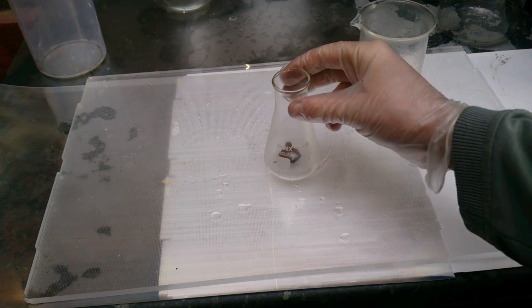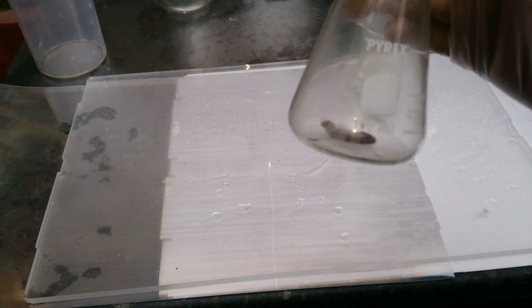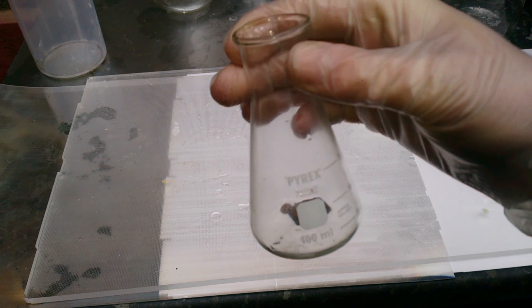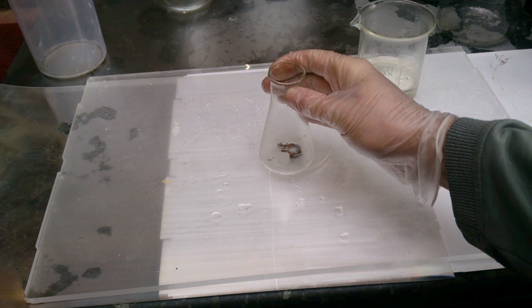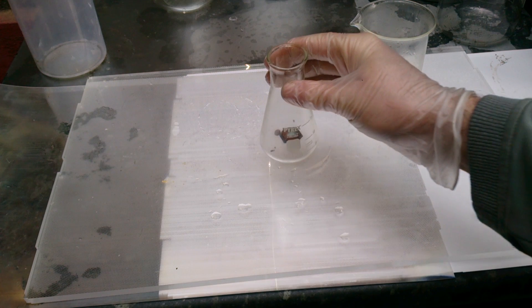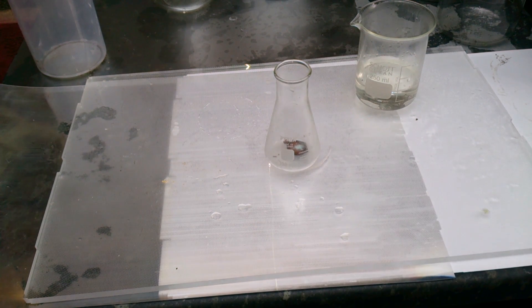What you can see is a really small and tiny flask, and inside there is one gold bullion I melted myself. It's really far from being pure gold, but a really dirty alloy. This particular bullion was made after etching quite a lot of different contacts. Thanks to that, I'm able to purify gold using a 100ml flask, not a 5 litre flask. I also put inside one watch case. I'm not certain if this is actually a golden case, because it's not hallmarked, but it looks like 9 carat gold to me.